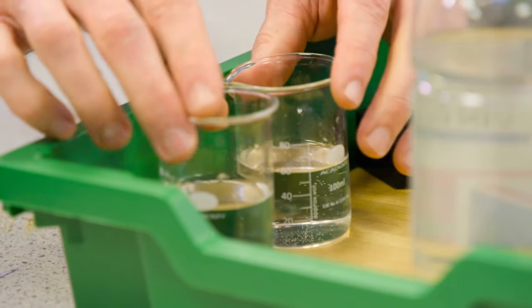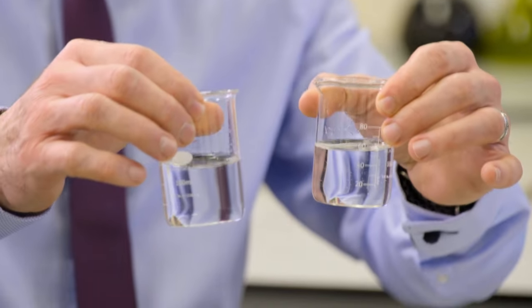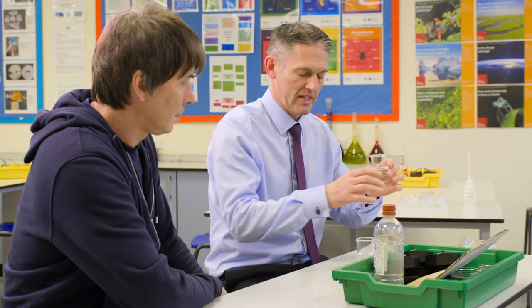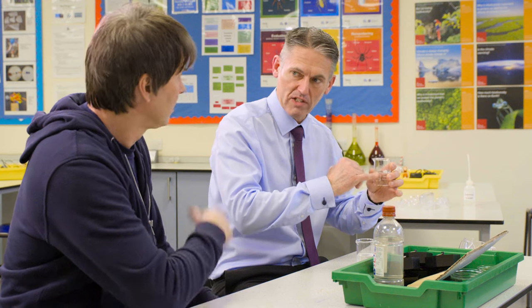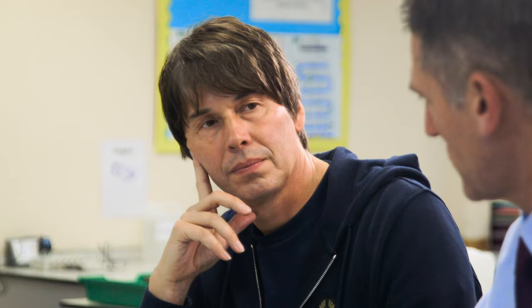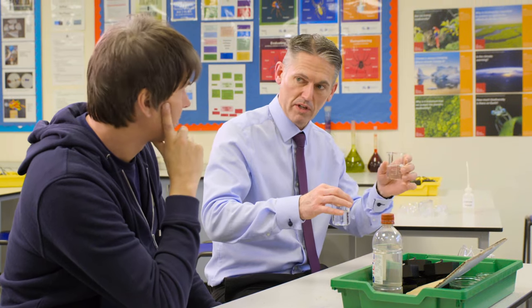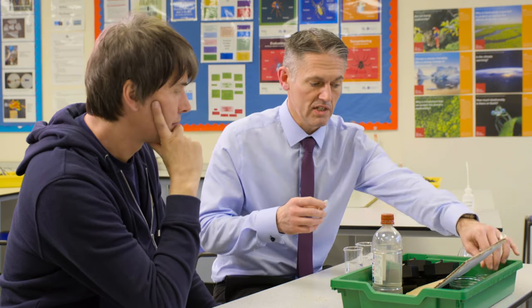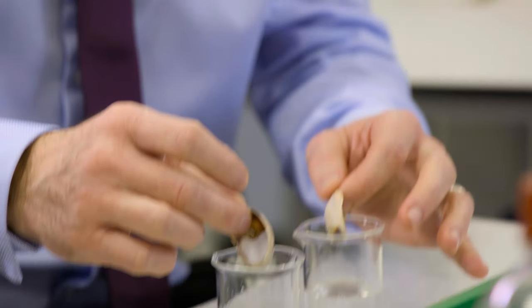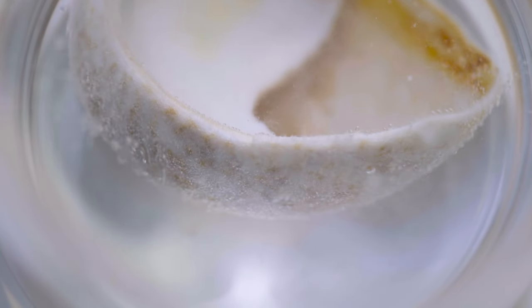Now we need to get a couple of beakers again — same size, small preferably — and make a couple of solutions. One is about 30 centimetres cubed of sea water and then 30 centimetres cubed of vinegar, so a half and half mix. In the other beaker, we have the same volume but just vinegar. This is to see what the effect of an acidic environment would have on a seashell. When we place the shells in them, we would see a difference in the number of bubbles produced in the full acid compared to the half and half solution. The students will write down their observations.